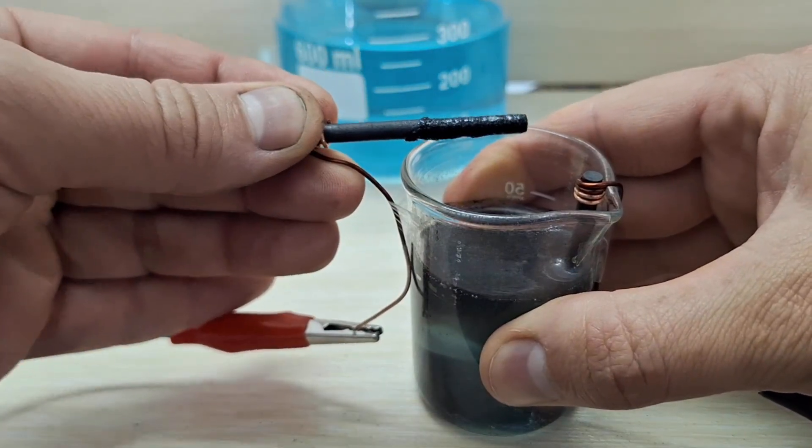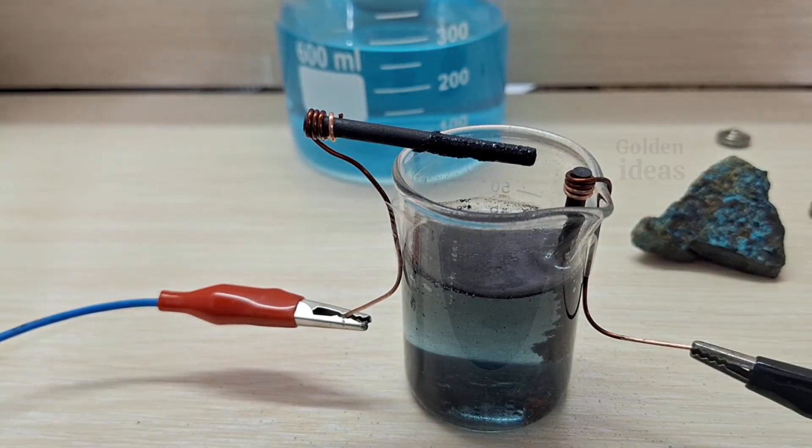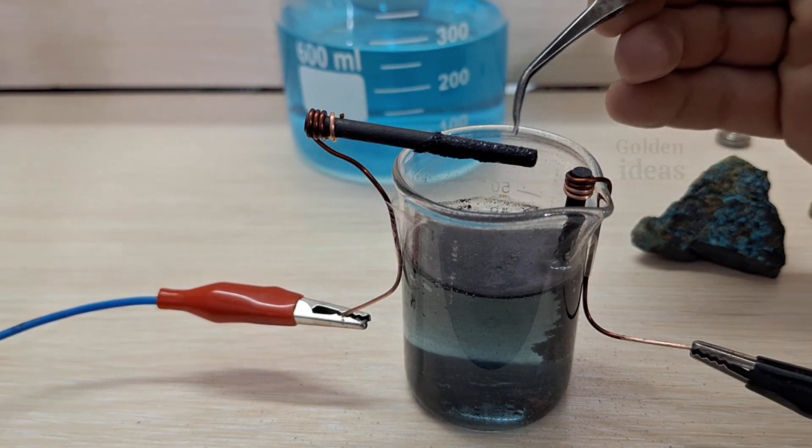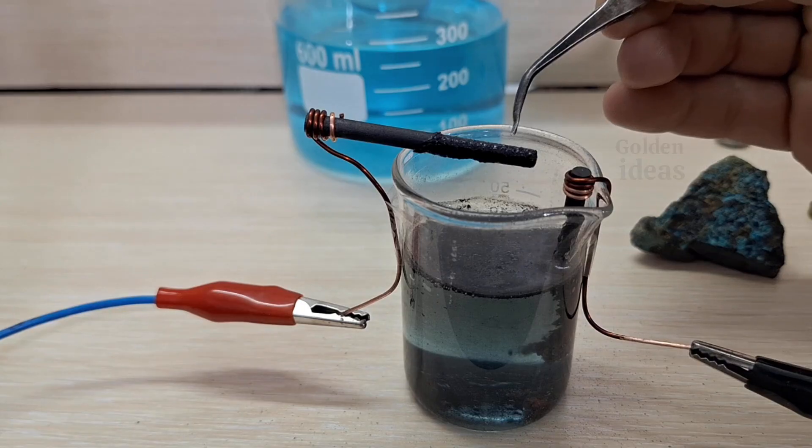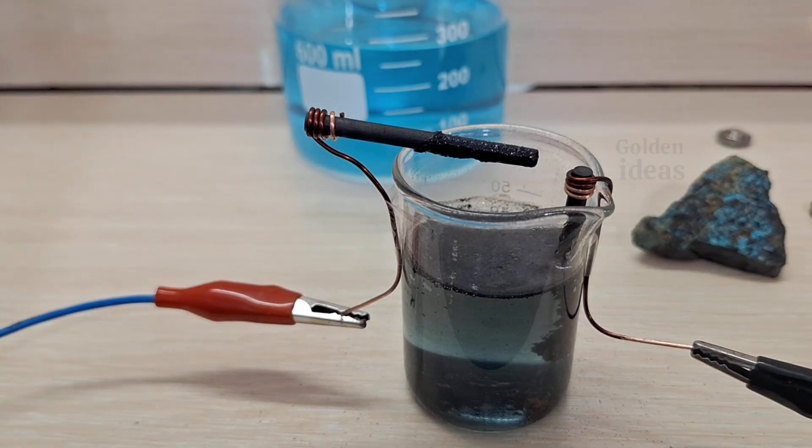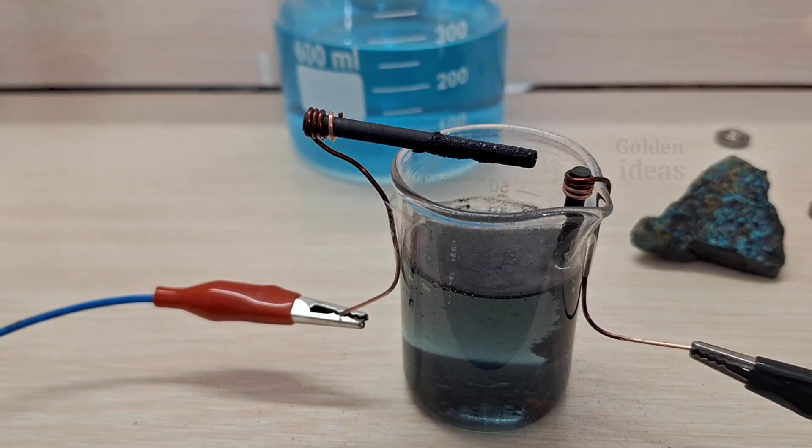For example, iron can precipitate many metals, including gold. As for the cathode, it's best to use pure titanium sheets because titanium doesn't dissolve easily in acid and remains stable throughout the process.